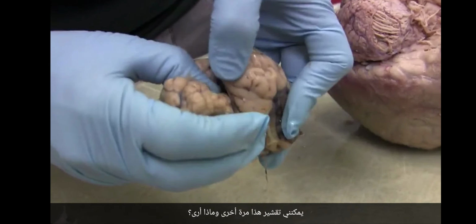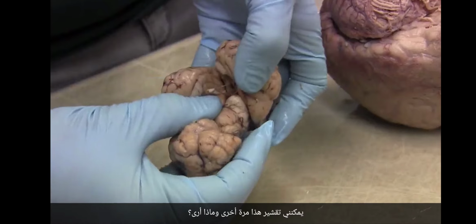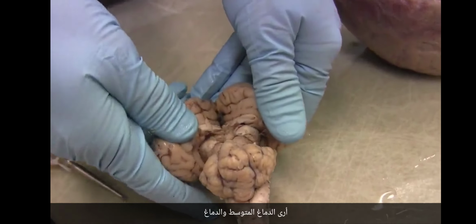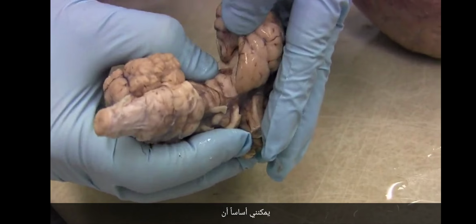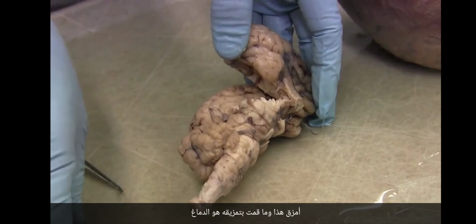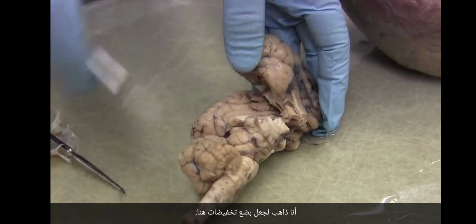I can peel this back, and what do I see? I see midbrain and diencephalon. Look at that. And all I can do, I can basically rip this off, and what I've ripped off is the telencephalon. I'm going to make a couple of cuts here.